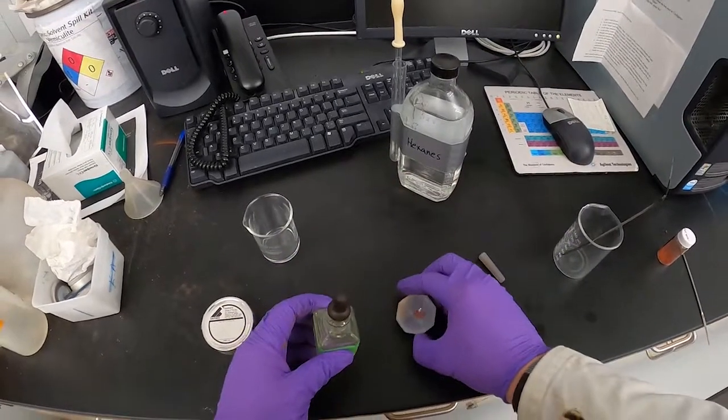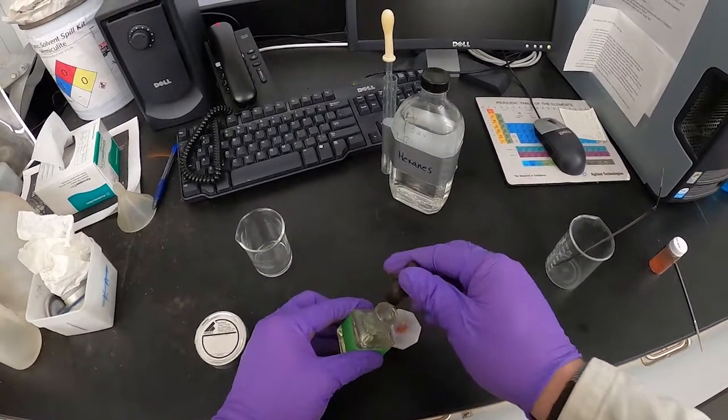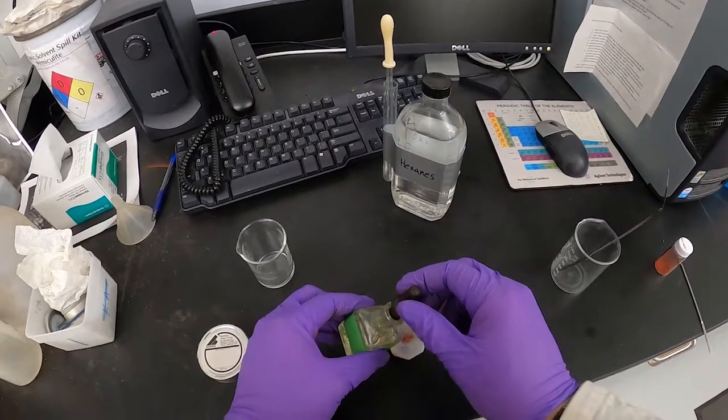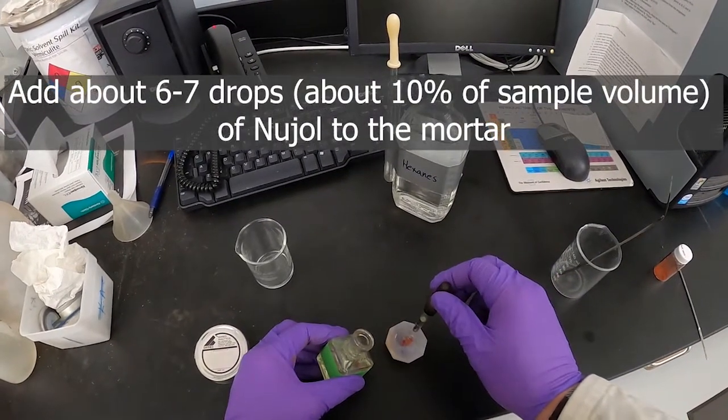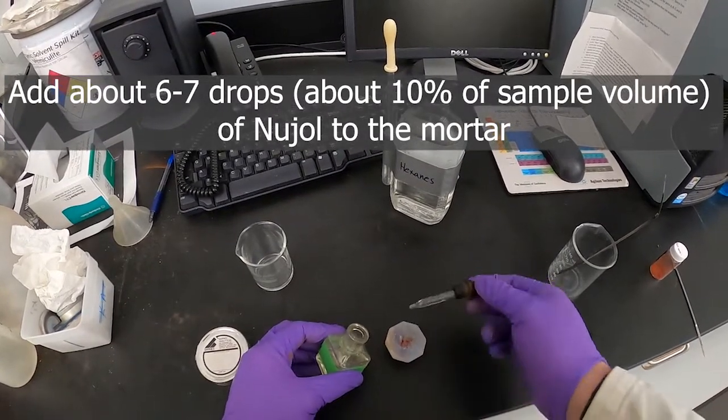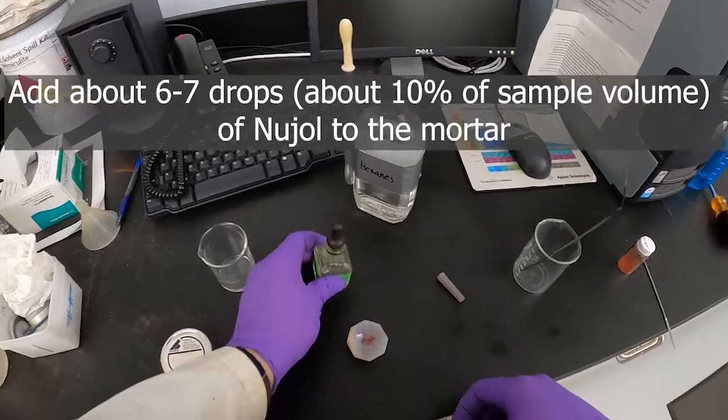We'll take our Nujol and add that, probably six or seven drops.